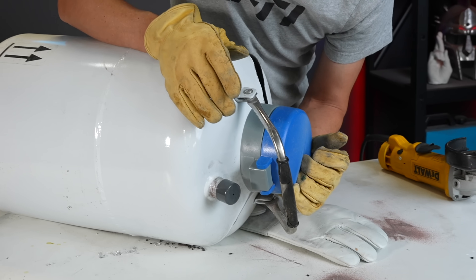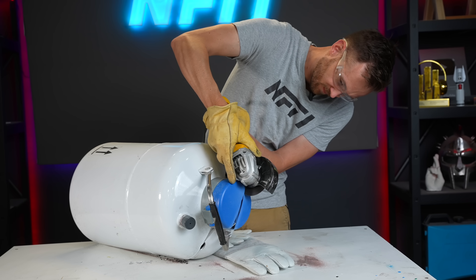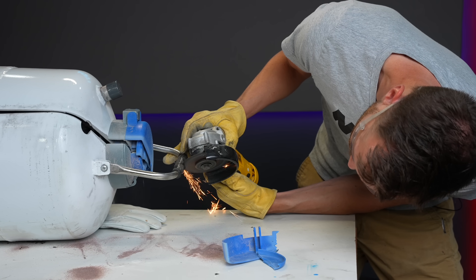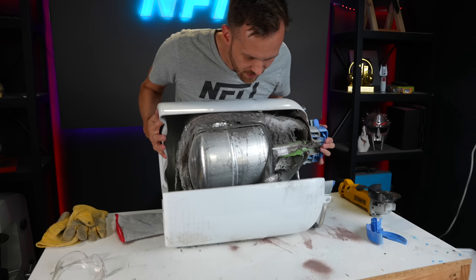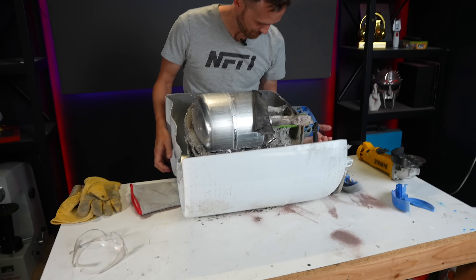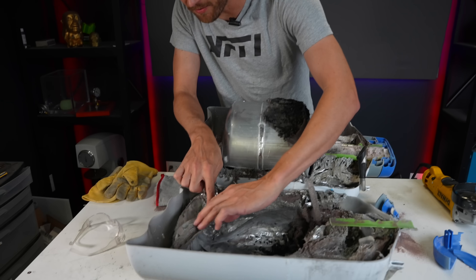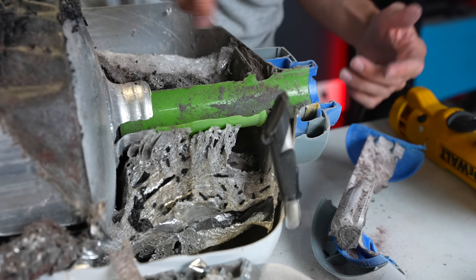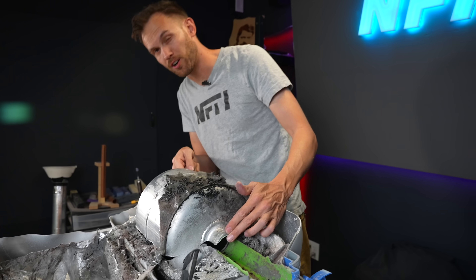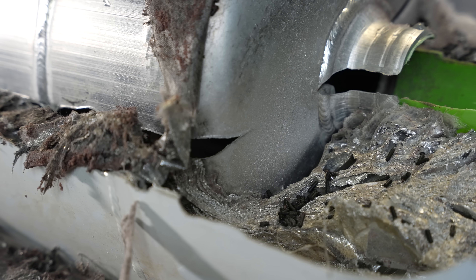The waterjet got this almost all the way cut through. On this side it looks great, but we're going through unknown stuff in the middle, so I'm now going to use an angle grinder to get through the edges and peel this apart in layers. There's part of the lid that didn't get cut all the way through — that's just plastic. Now we can see a few things: we've got plasticky-looking beads around the outside, we've got layers of insulation and an interesting plastic channel. Most plastics get so brittle at these temperatures that they could just fall apart, which is surprising. And of course we have the inner tank — this is the actual volume where the liquid nitrogen is held. You've got a lot of space around it which, as we tested, was at least low pressure, possibly almost a full vacuum.